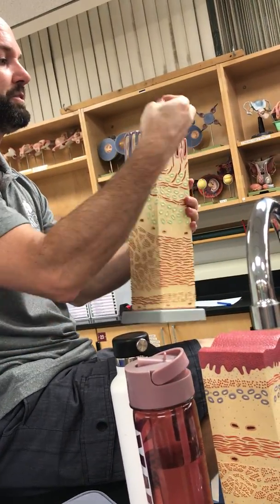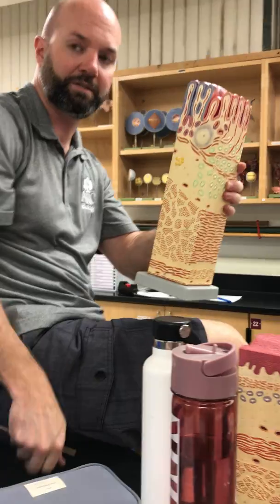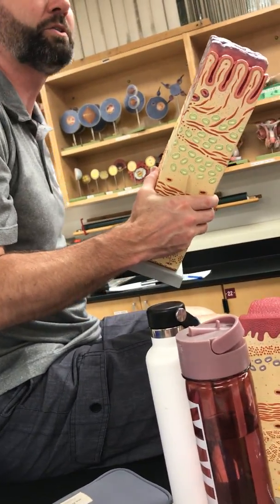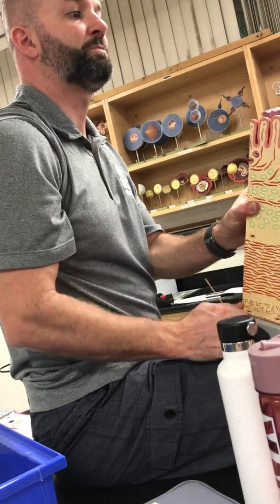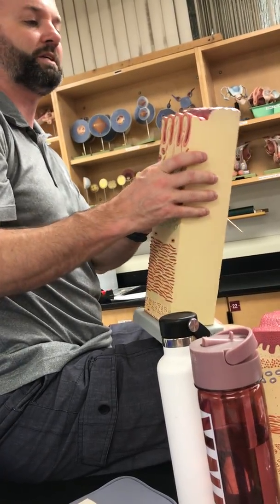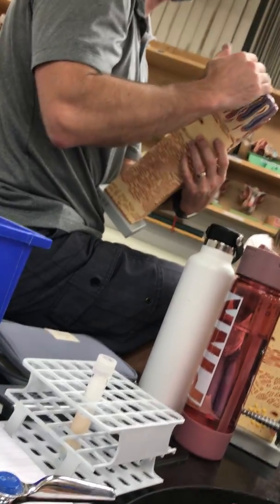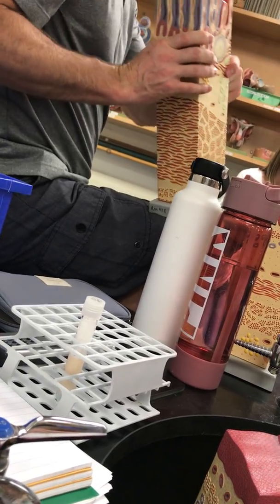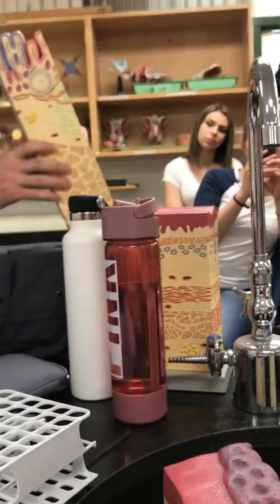All right, so you see villi. So that tells you this is small intestine. So we're either looking at the junction between small intestine and large, or small and stomach. So large intestine and stomach have kind of similar characteristics at the top because they both have simple columnar epithelium and they lack villi. It's kind of flat. So really what I would do is I would go to the intestine side of this and figure out, is it duodenum or ileum? And if it's duodenum, then this is stomach. And if it's ileum, then this is large intestine.